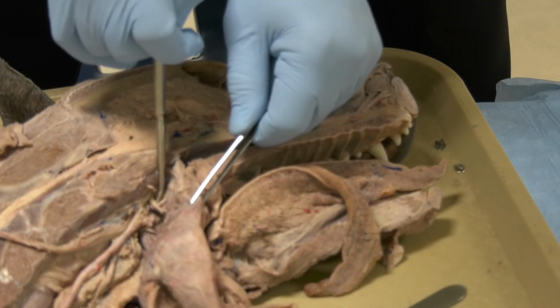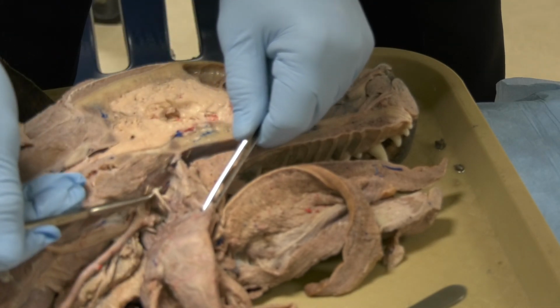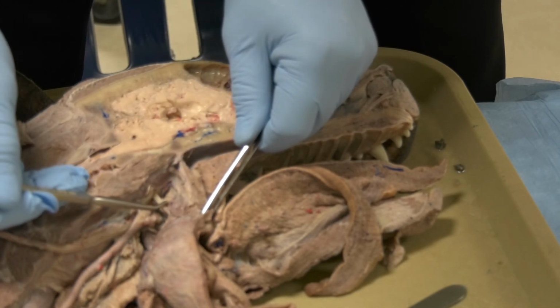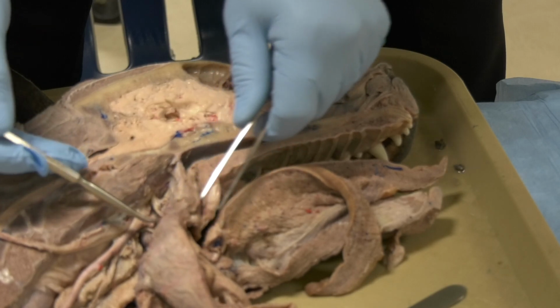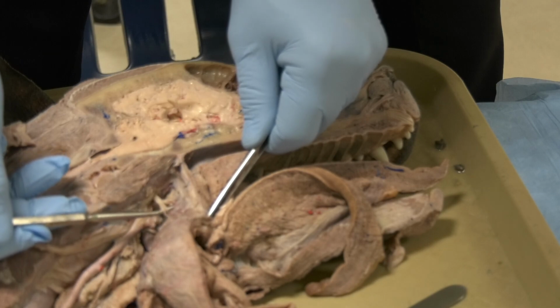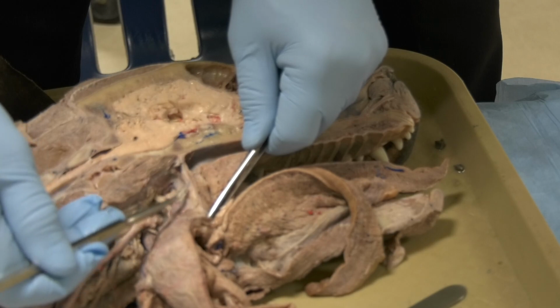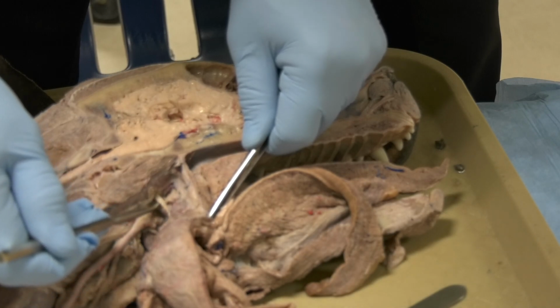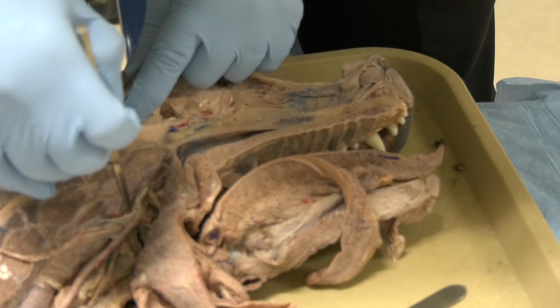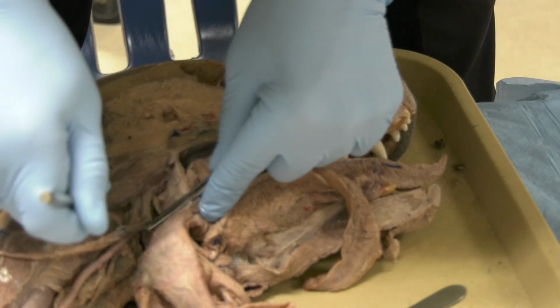This nerve you see here, this is the glossopharyngeal nerve. And the glossopharyngeal nerve divides into two branches. One is going to go to the tongue, and the other one is going to go to the pharynx. This is the glossal branch, and this is the pharyngeal branch that goes to the pharynx. So this is the glossopharyngeal nerve, okay? The one that you see on the dorsal aspect there.